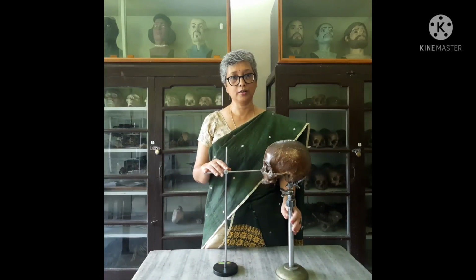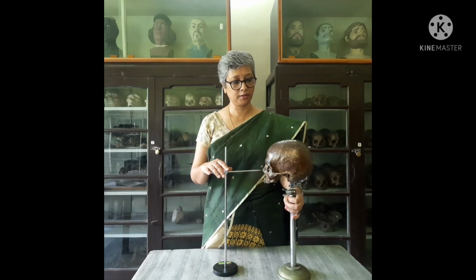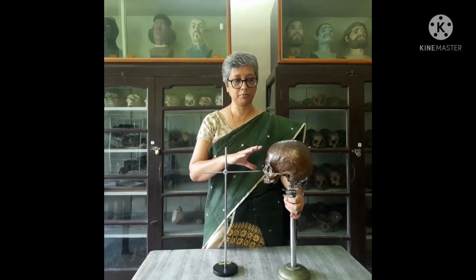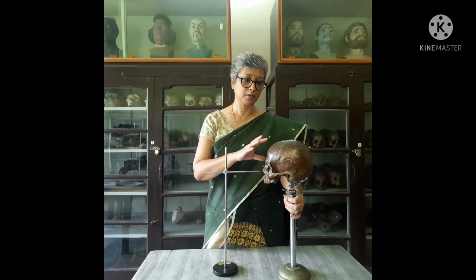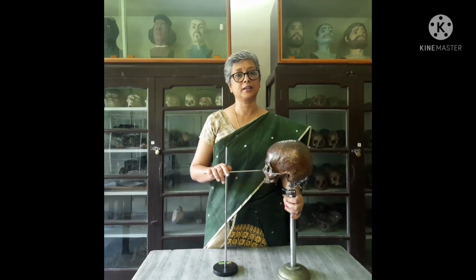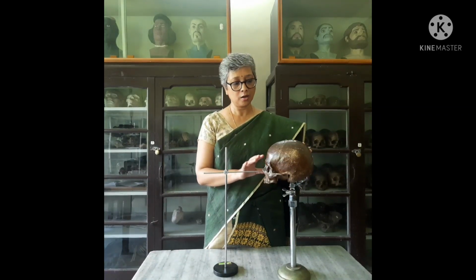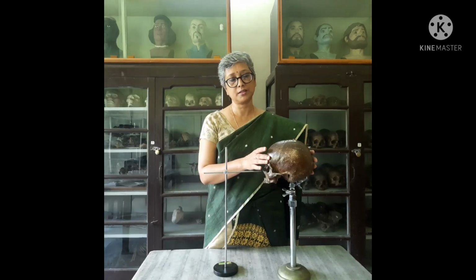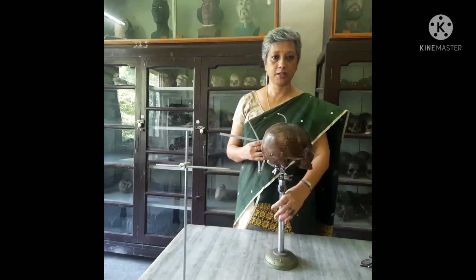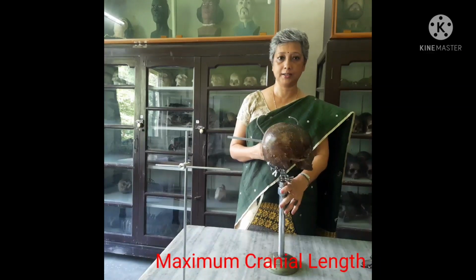After orienting the skull on the Frankfurt horizontal plane, different types of measurements can be taken on the cranium. We have linear measurements and angular measurements which can be taken from different landmarks on the cranium. Measurements can range from length measurements, breadth measurements, depth, height, chord, circumferential measurements, and arc measurements. We will now demonstrate how to take the linear measurement of maximum cranial length.